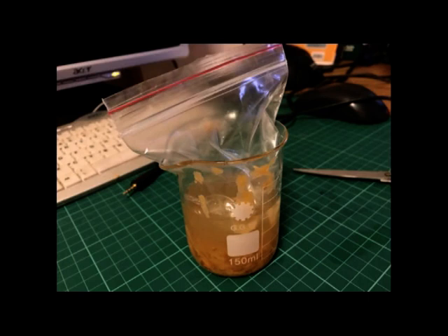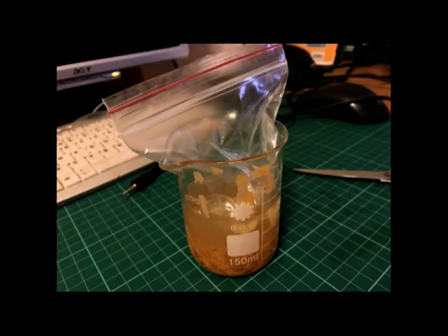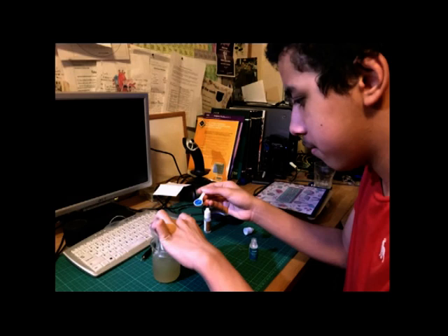Secondly, you will have to get your polyethylene bag and place it inside the beaker, but have the top out so that it is completely watertight. After this, you will need to put one spatula of copper sulfate into the bag.